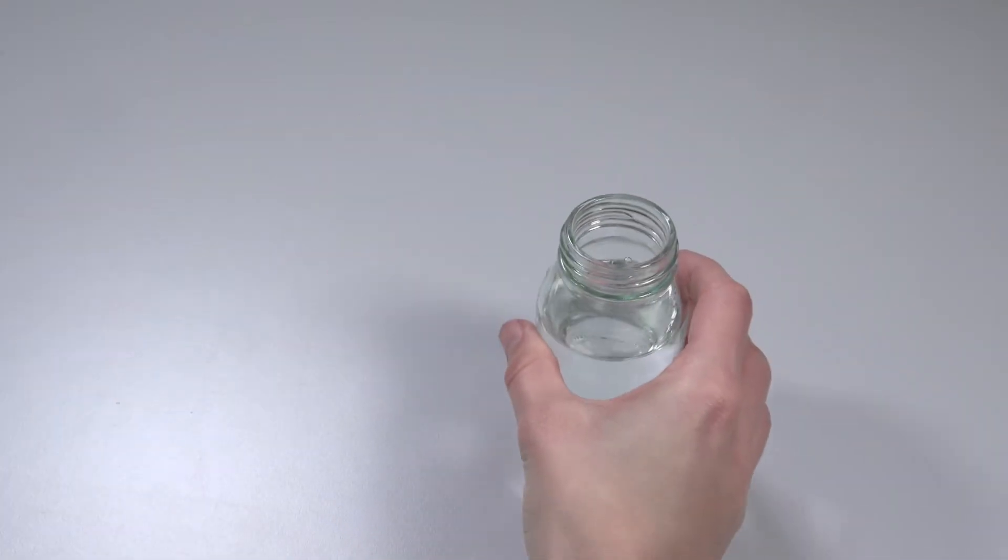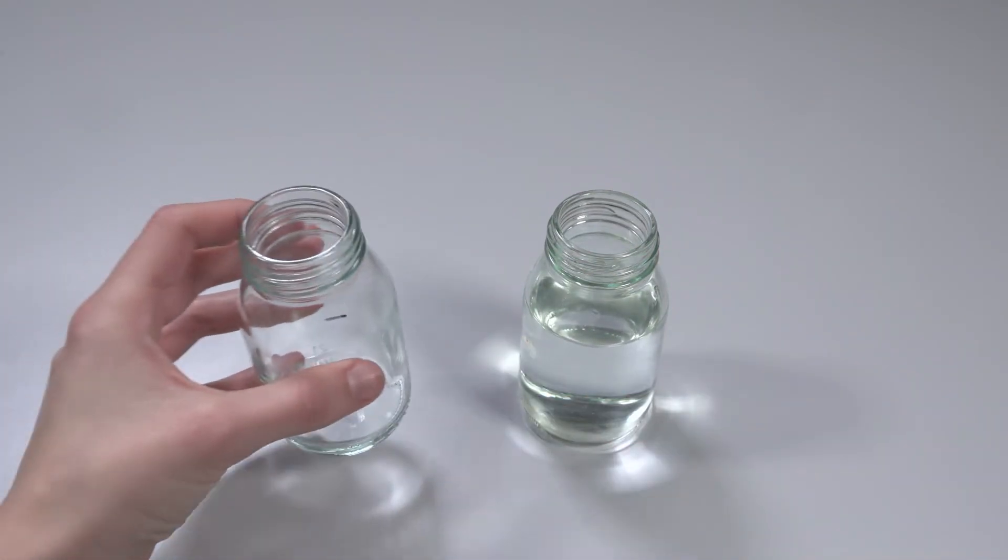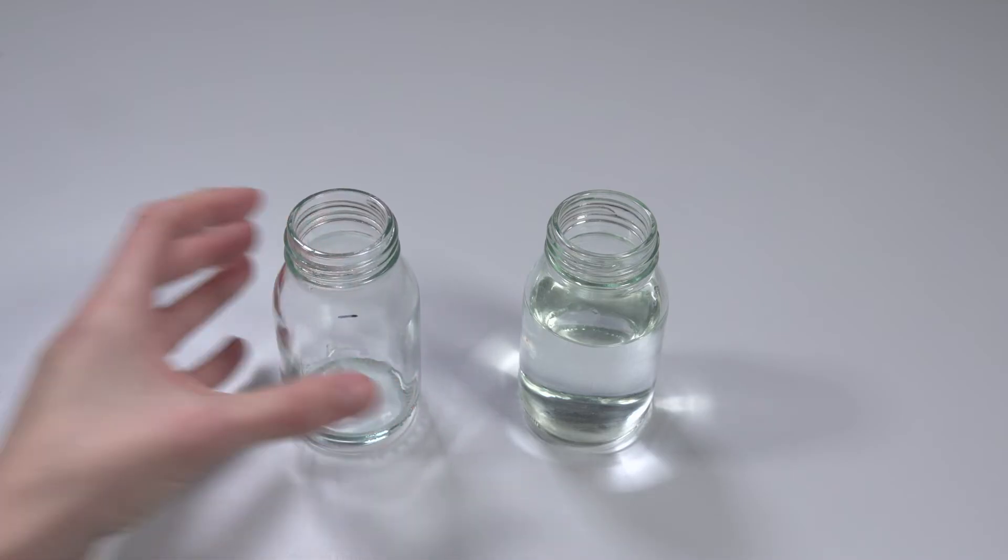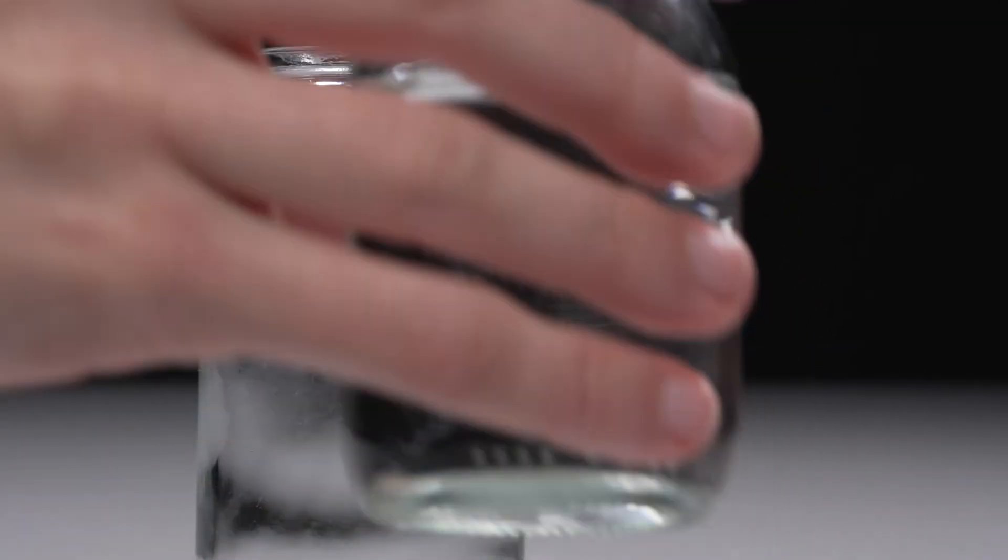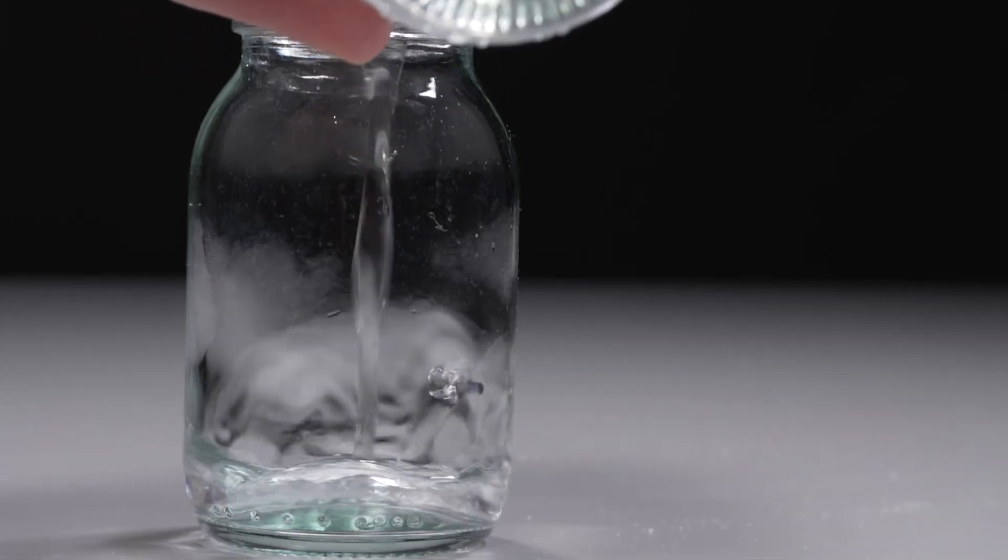The hot-cold method allows the mixture to cool faster, reducing the preparation time. First, about one-third of the weighed water is poured into a glass.